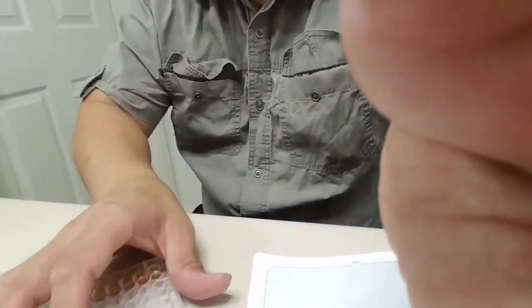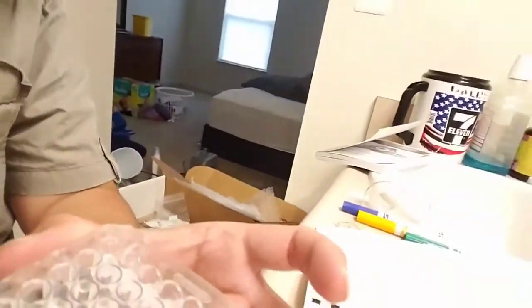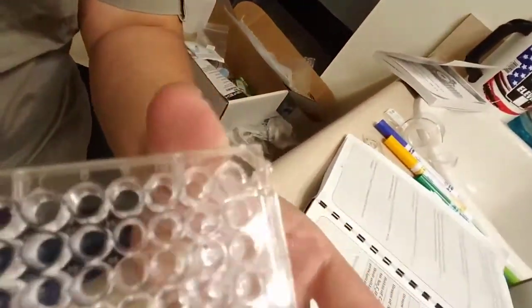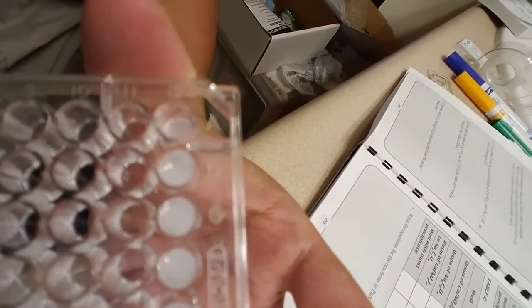Let me show you the results for part B. Let's see if I can show this to you real quick. I can't really. Whoa. Hold on, one second. All right, here we go. Let's flip the camera around. Can we do that? No, we can't do that, not while we're recording. All right, here we go. Can you see that? There we go.